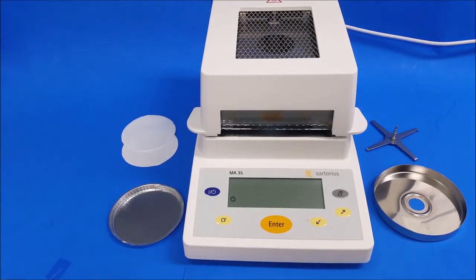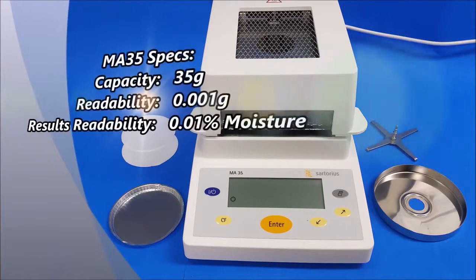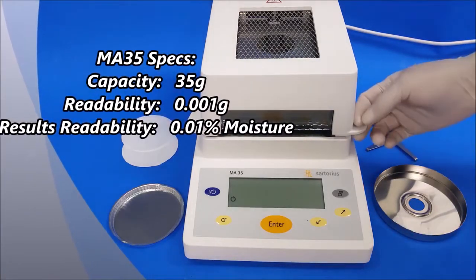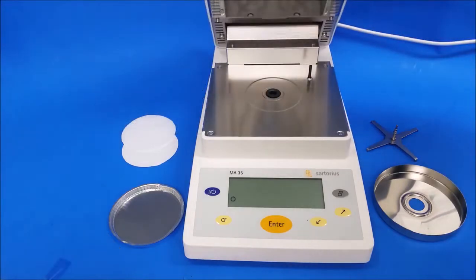Hello everybody, DSC guy here. Today I'm going to show you how to run a test on your Sartorius MA35. First, we're going to put in the original parts, so open up the hood.